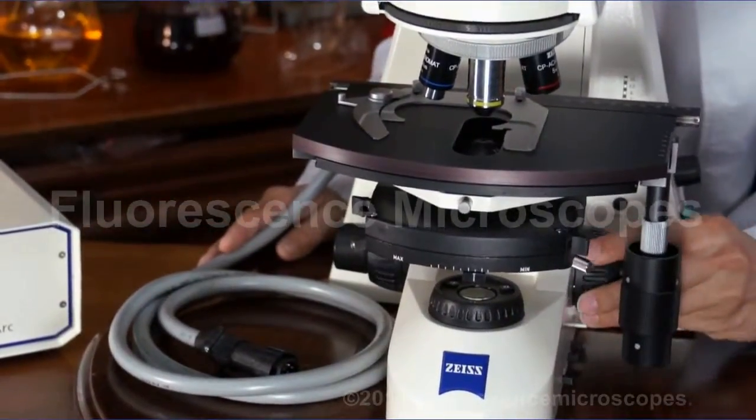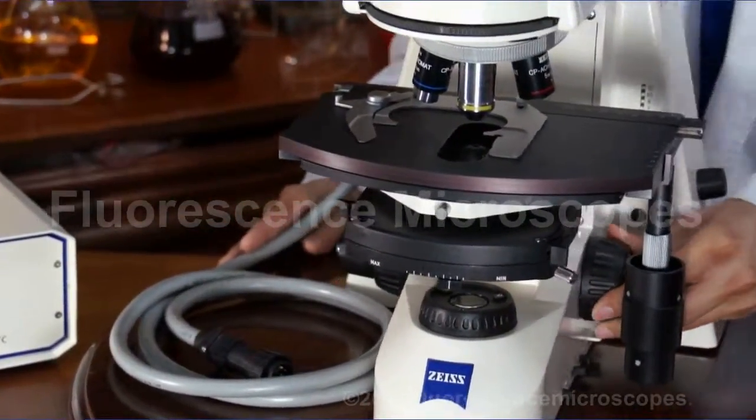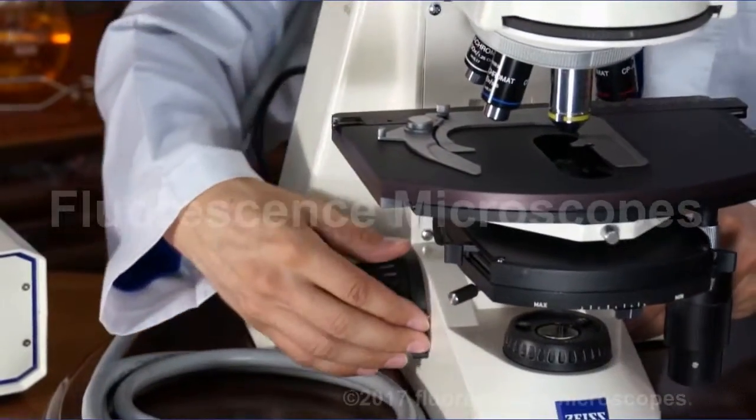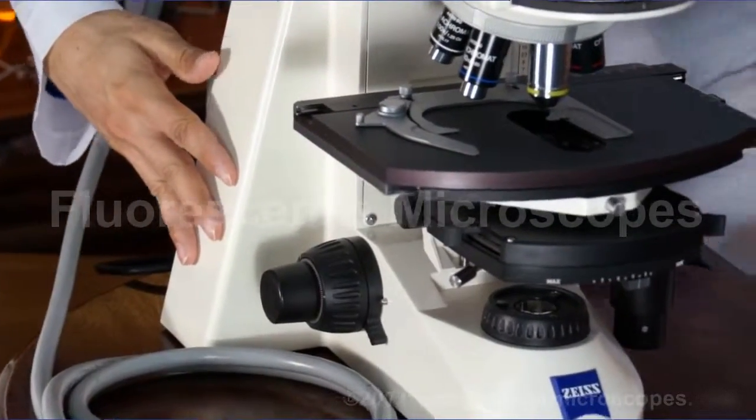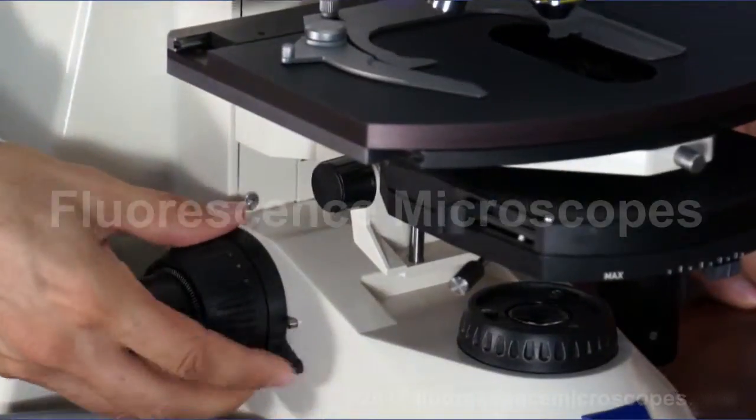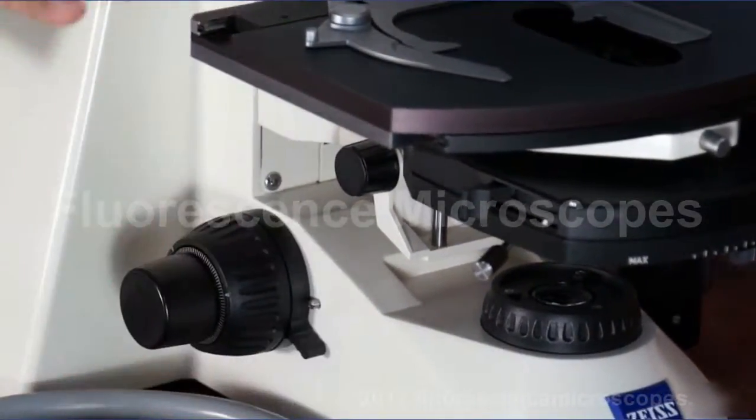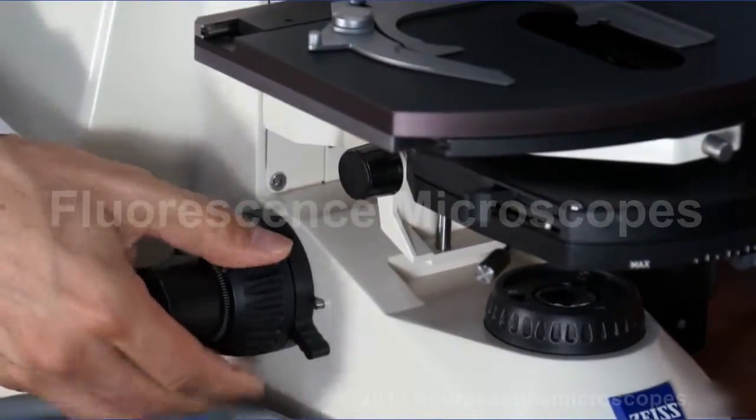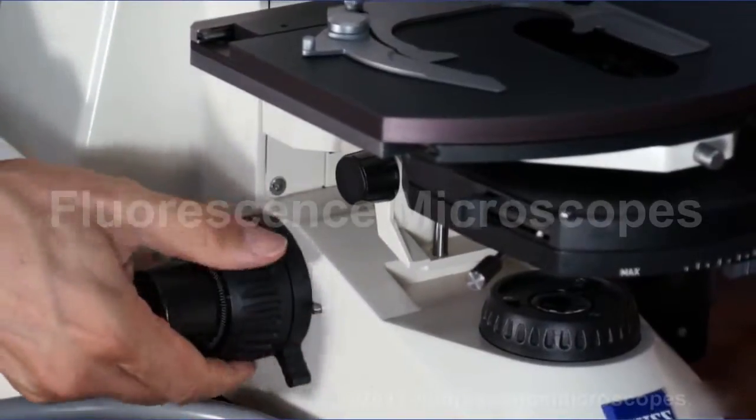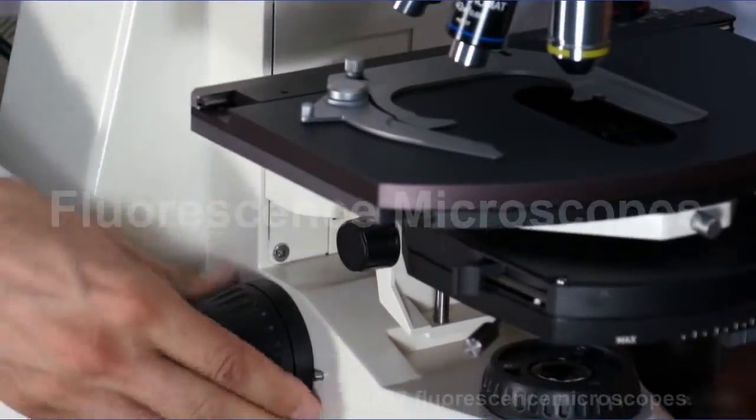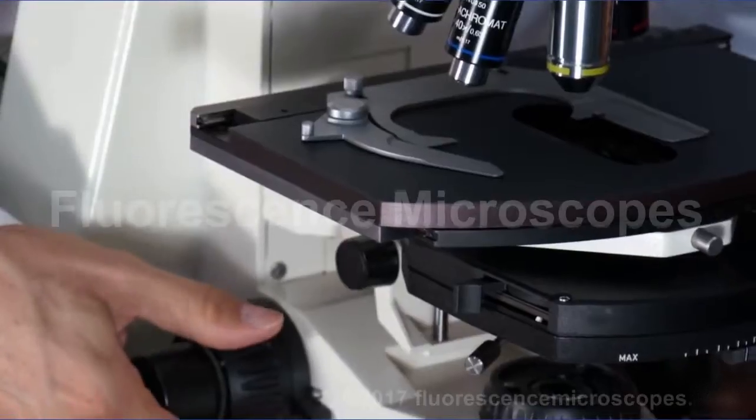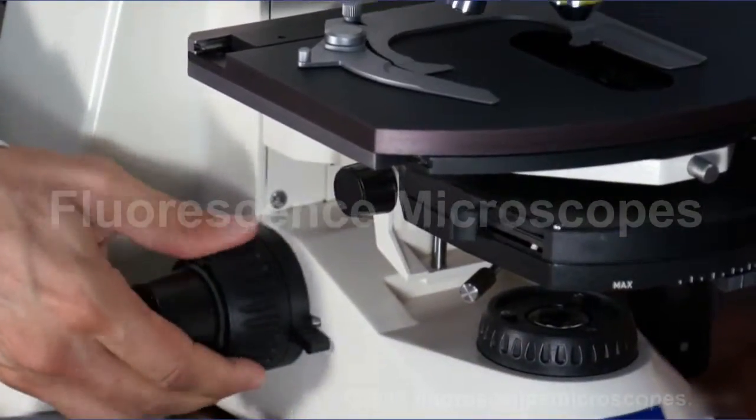It's got fine and coarse focusing. It's also got a travel lockstop. This is a focusing travel lockstop. So I'm lowering the stage. If I set it, then it won't raise any more. So you have to turn it off to be able to raise and lower it.